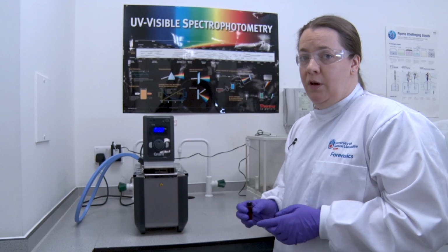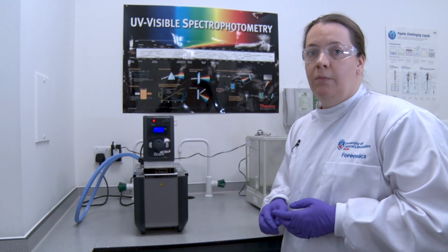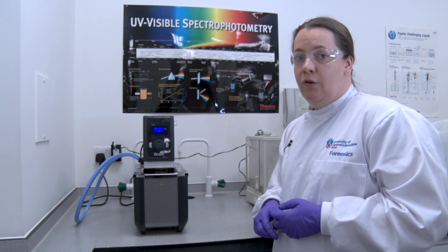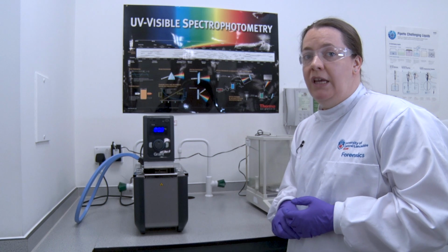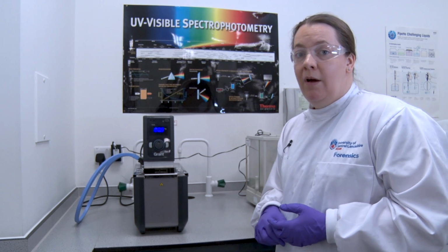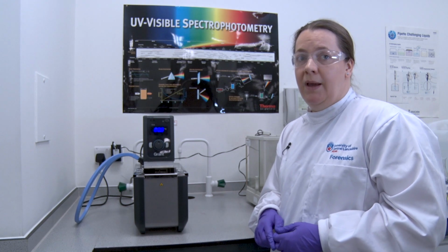Now you've made up your samples, you're going to come and put them in the water bath. There's a tray in the water bath where you can put all your samples, and there's room in the trays for the samples of the other groups. You're going to leave your samples in the water bath for the time on the practical sheet and only take them out when you're ready to inject. They need to be in for a minimum amount of time so that you set up the equilibrium between the alcohols in the solution and the alcohol in the headspace.